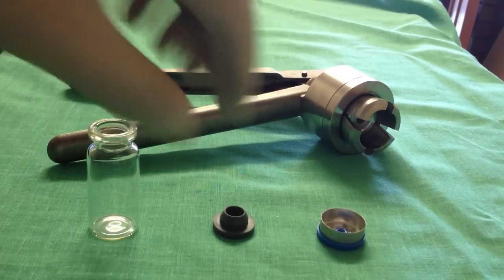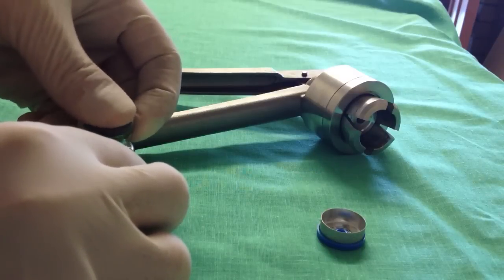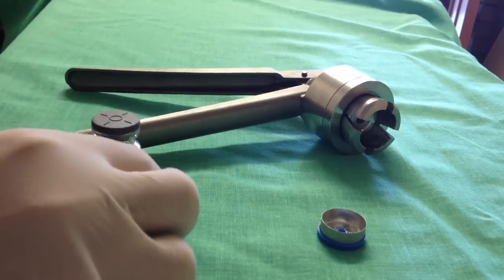Now, you simply just need to get the rubber stop, place it over, push it in firmly so everything is level.